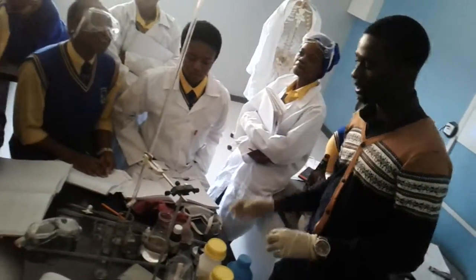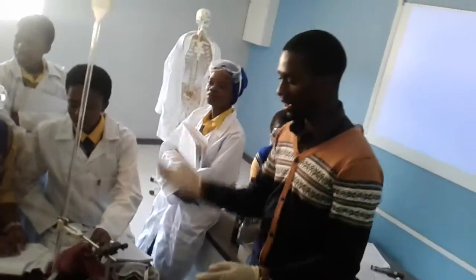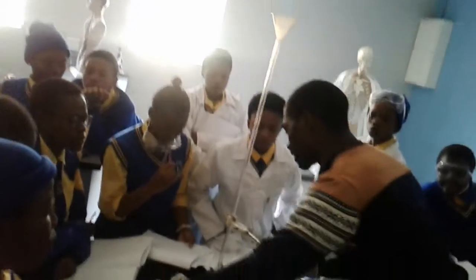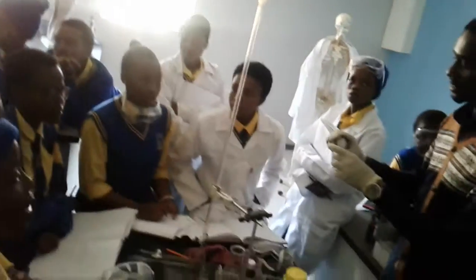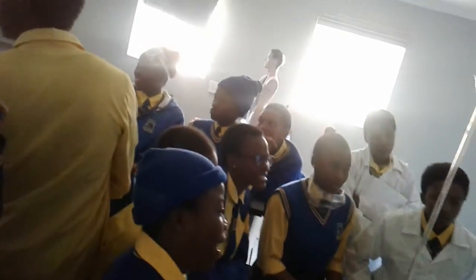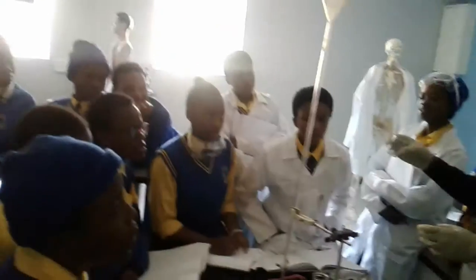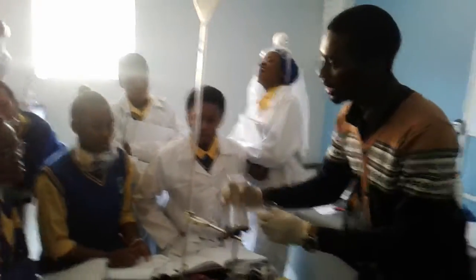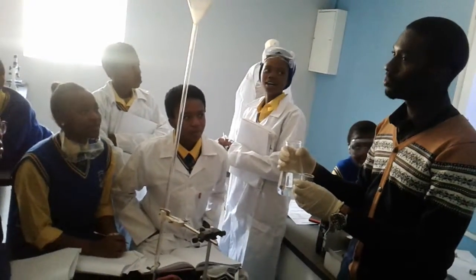Vanessa, go fetch me a spoon there, if there is. And measure everything. So what you guys are going to do in groups, right? First of all, you're going to measure the mass. Come with a thing that measures things. It's called a kitchen scale. Okay. So, is this solid, liquid, or gas? Solid. So now, I'm going to add this in. Guys, if you want to talk, can you please go talk outside?